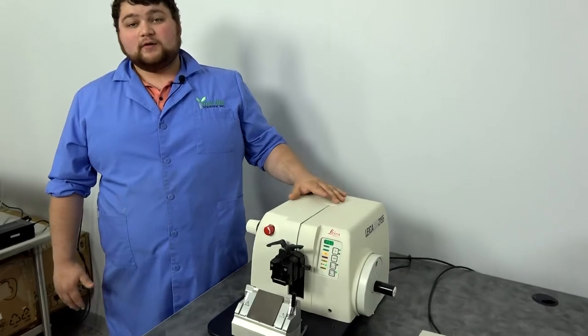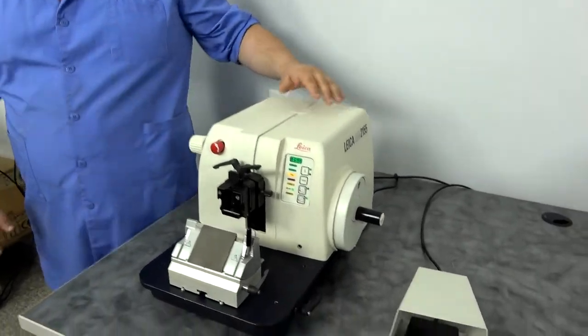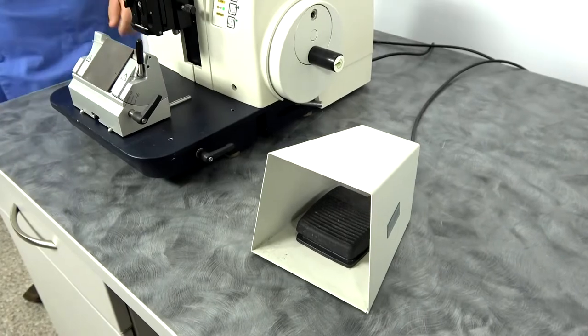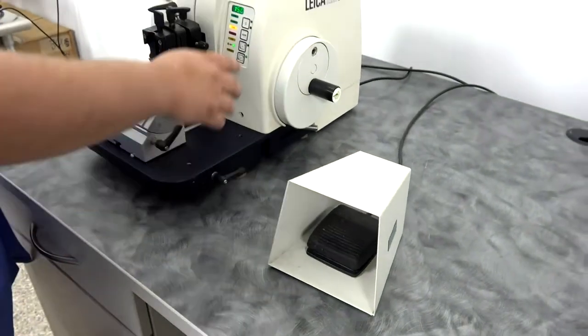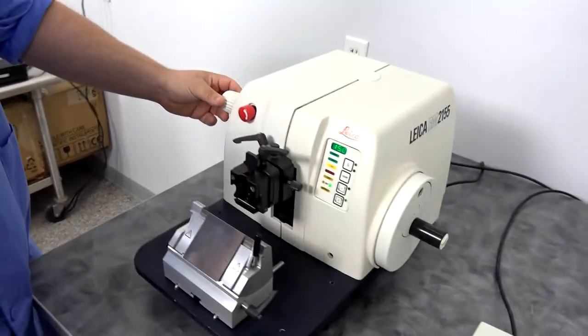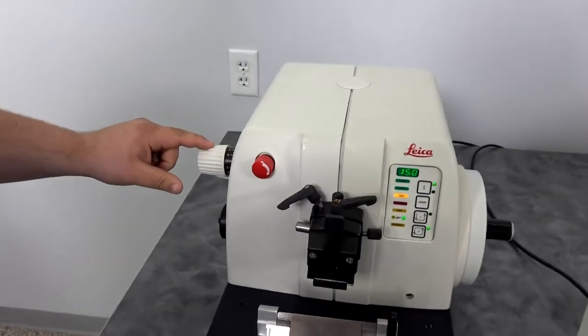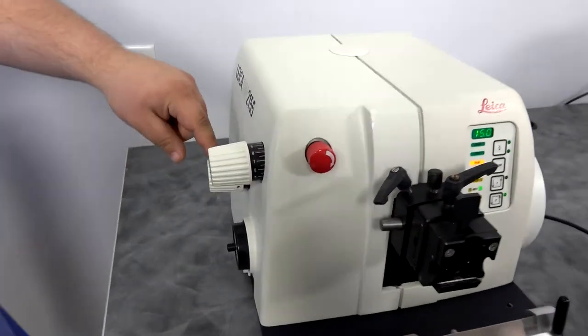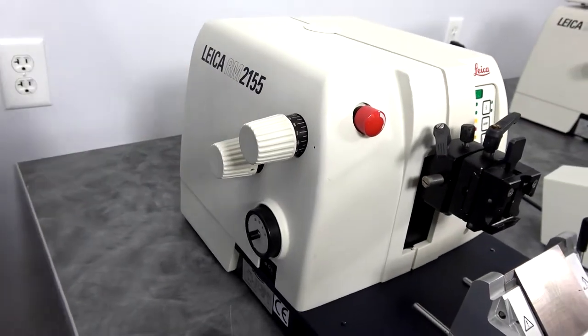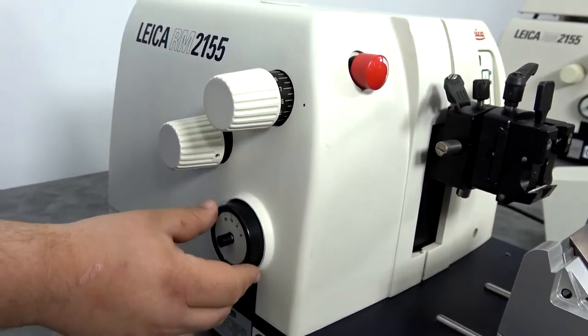This particular model is foot pedal operated. You can see over to the right there. We'll come over here. You have your cutting speed adjustment knob, your cutting thickness knob, and then you have some preset here.